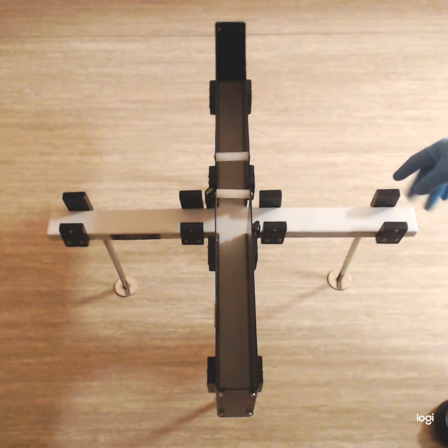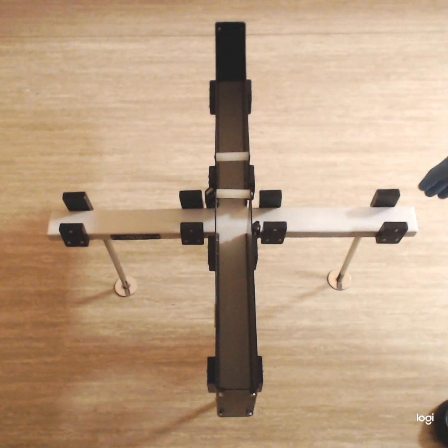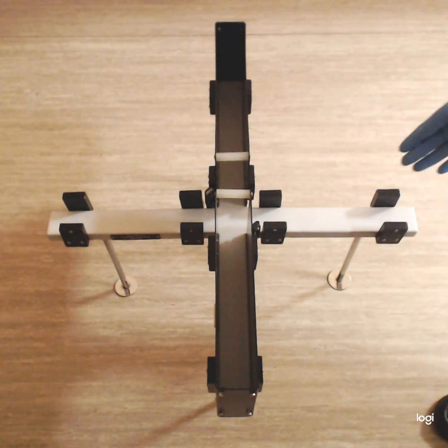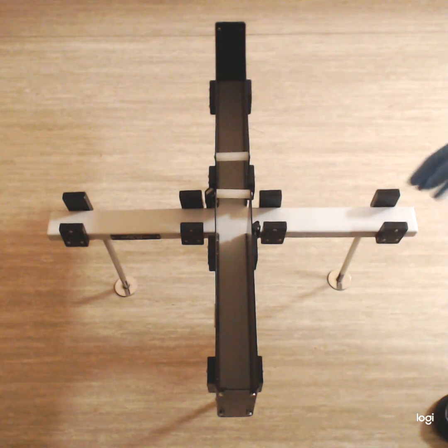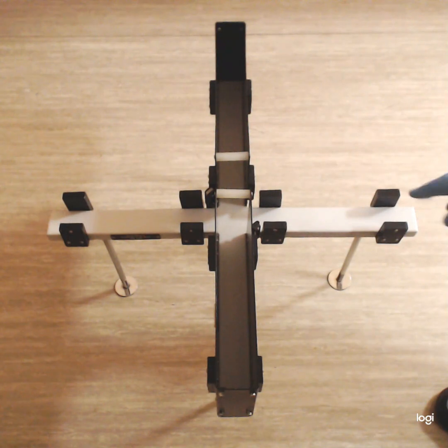behaviors, like head dips. When the animal is on the open arm, it will peep, or it will try to look at the bottom, so to explore. So it's called head dips. Head dips. Okay, dipping the head to look what is there below. And also vertical rearings.